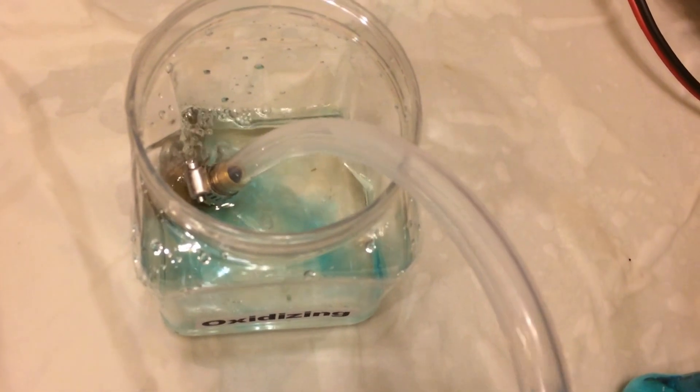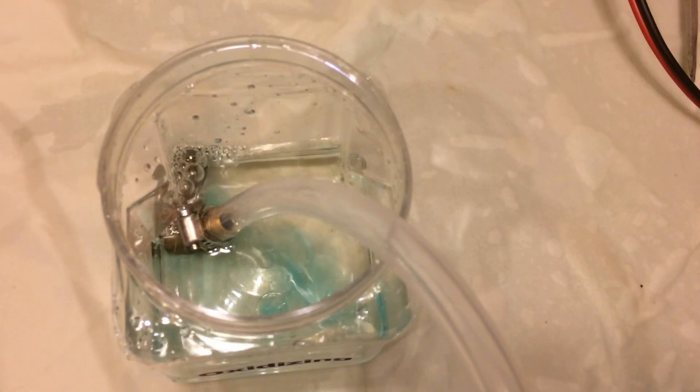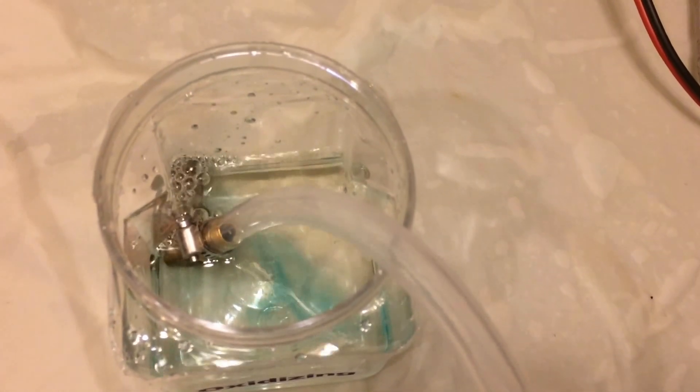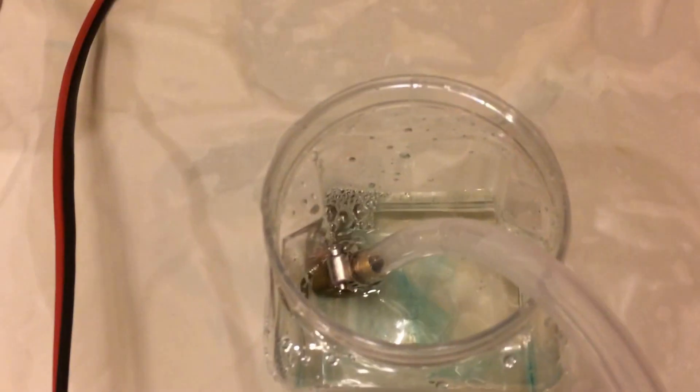What are we at current-wise? We're a little bit high now. Right where we should be. The color's gone. What time are we at? 1.59.